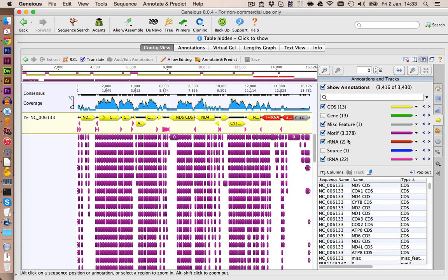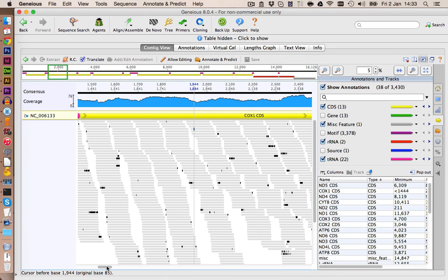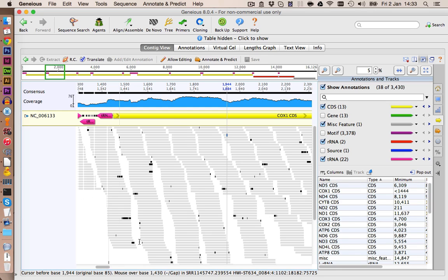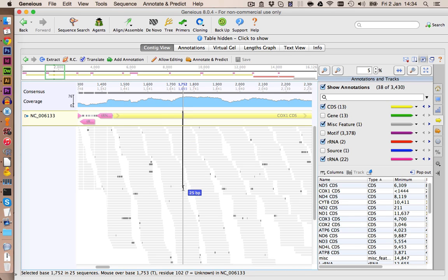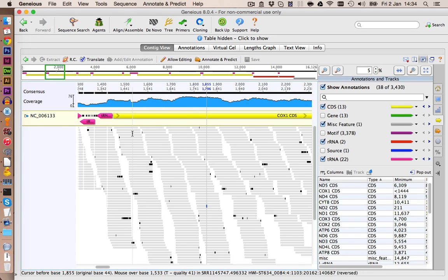For now, let's disable the annotations we have just added, and we zoom in here. So, despite some mismatches, this looks really good. Also, we can now be sure that we have only one organism sequenced, because if it would have been several organisms of the same species pooled in the same sequencing run, you would expect some single nucleotide polymorphisms, SNPs. So, for example, one base here would have an A, and all the other ones would have a G. But we only get some rare mismatches. Those are very likely sequencing errors. So this should perfectly be fine.